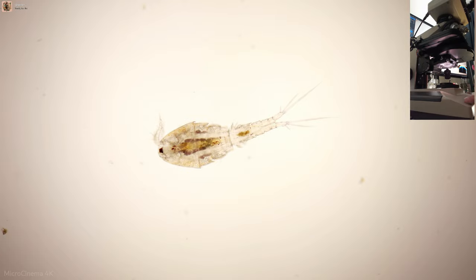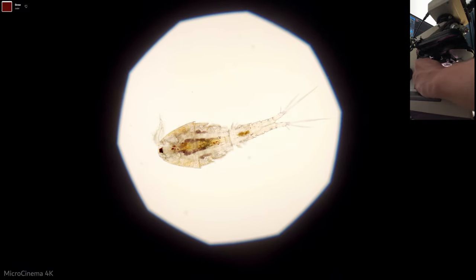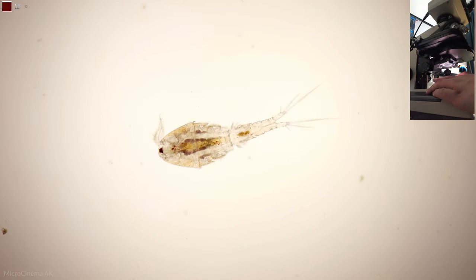But then in the aperture that would normally be for bright field, I've put a dark field patch stop. And so right now we are at pretty close to Köhler illumination. There we go.